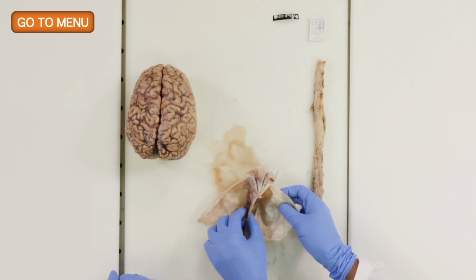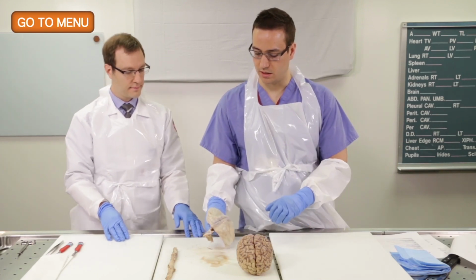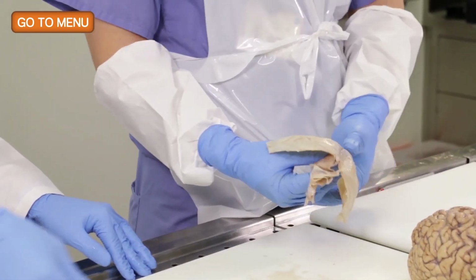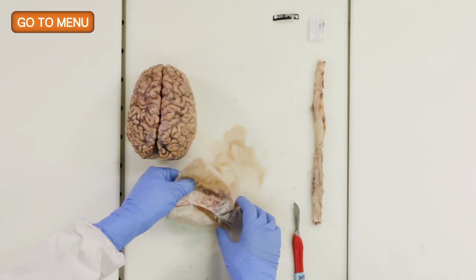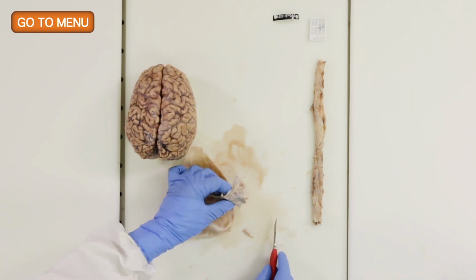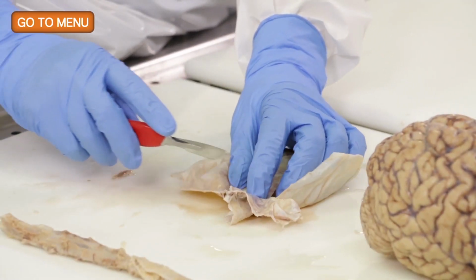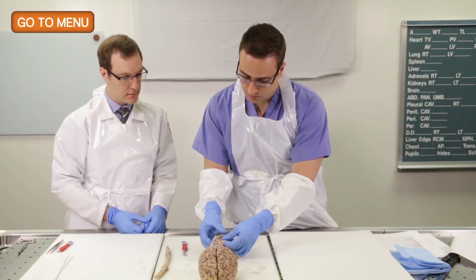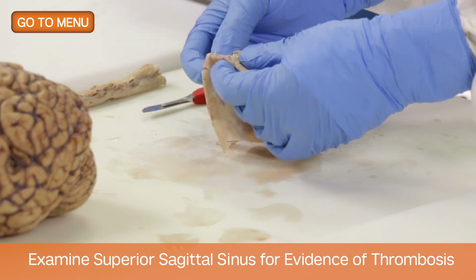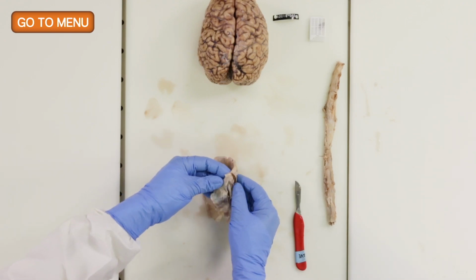And what else do we routinely look at in the dura? So one of the other things we look for is if there's any evidence of thrombosis in the superior sagittal sinus. So why don't you take a look at the superior sagittal sinus? So we'll make cross sections through the superior sagittal sinus, and if other sinuses are available, we'll also cut through those, again, to look for thrombosis. Right, so the sinus looks patent. So this is just one of the routine things that we'll always check for, regardless of the clinical history.